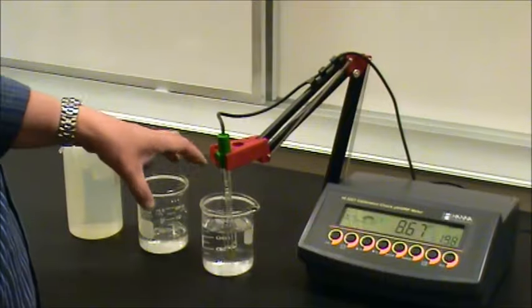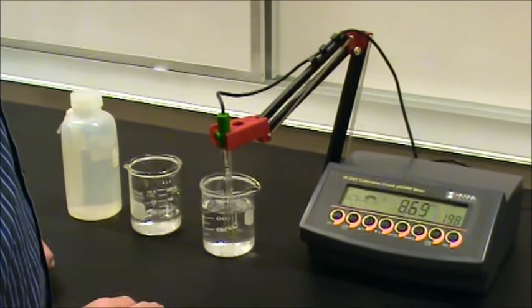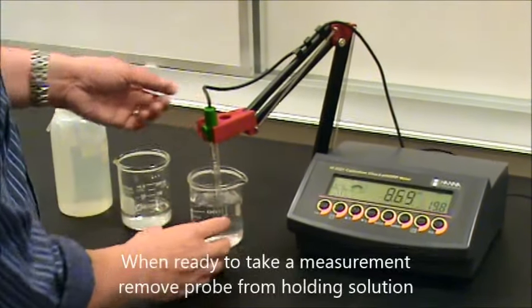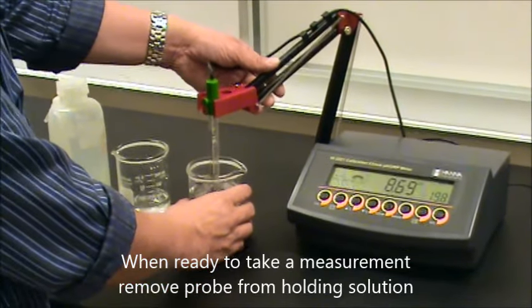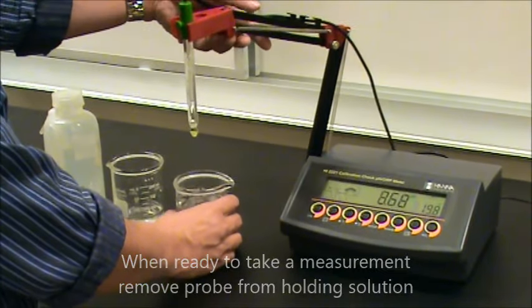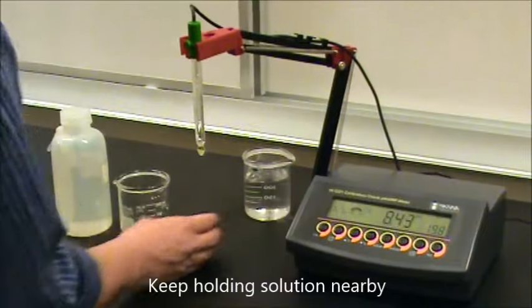That should be provided at the station. When you're ready to use the probe, the first thing you should do is remove the probe from the holding solution and then set it aside so it's very close by.